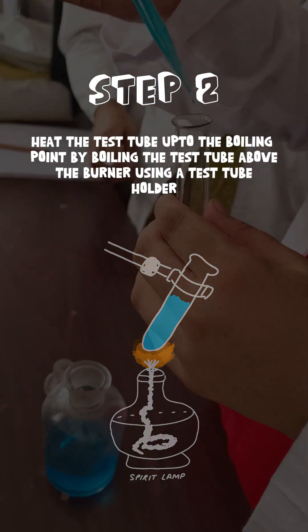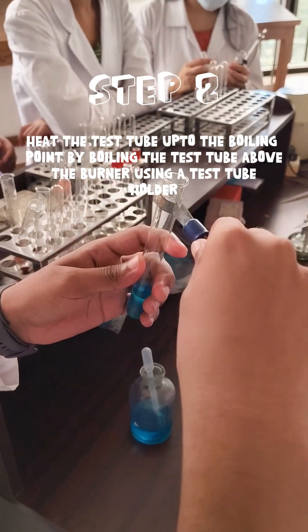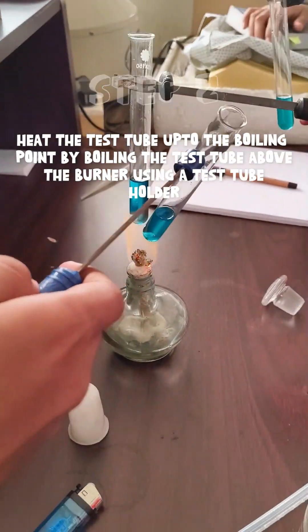Step 2: now let's heat the test tube with the help of the burner up to the boiling point, using a test tube holder.